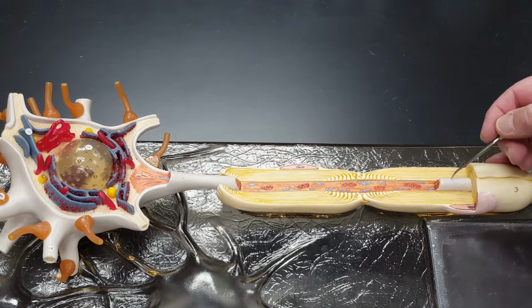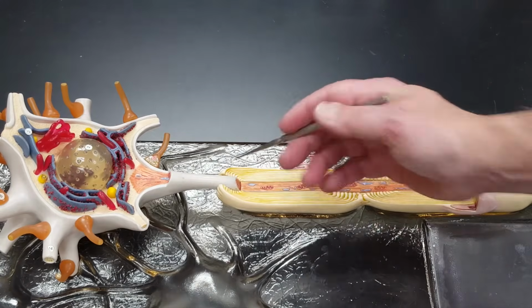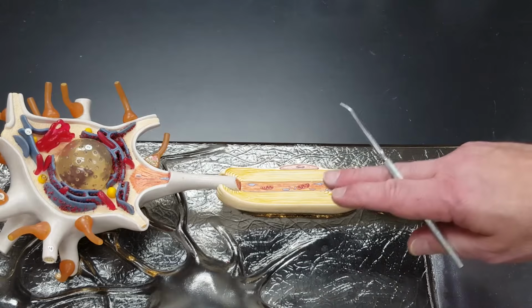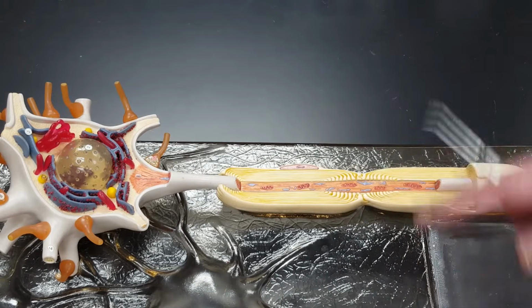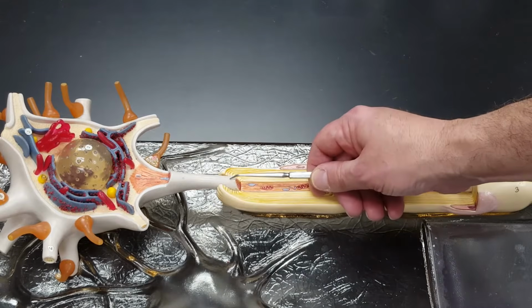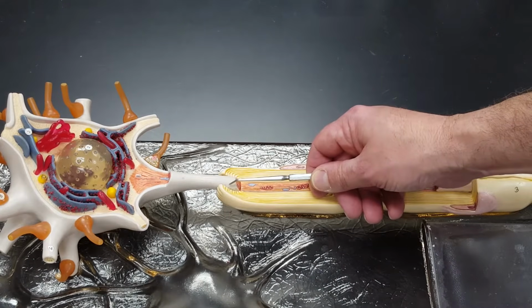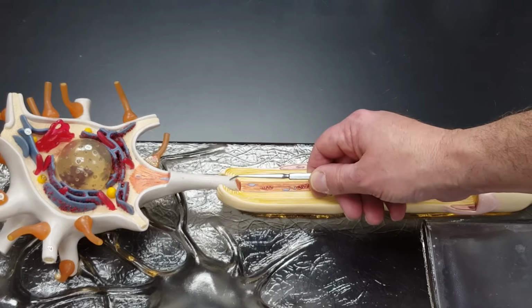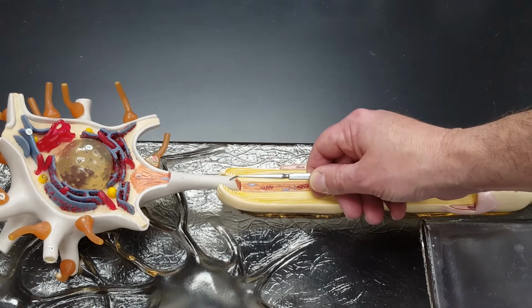This, the light gray part, is the cell membrane of the neuron, which is in this area surrounded by these Schwann cells. This is actually called, and I say this just because I know some of you want to hear it, the axolemma or the axonolemma, which is not on your list.